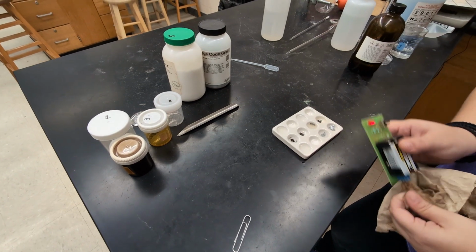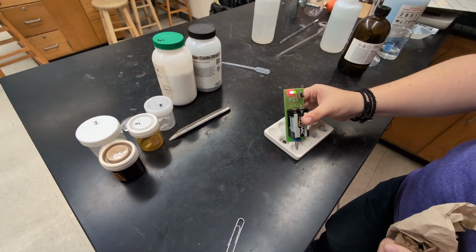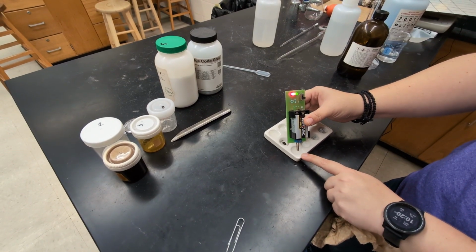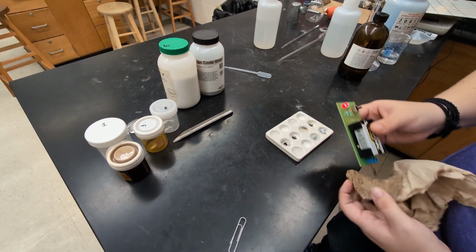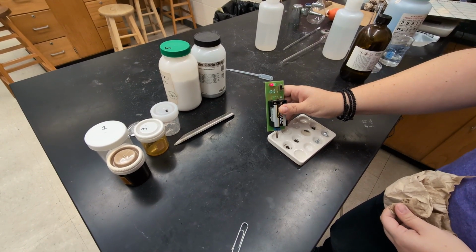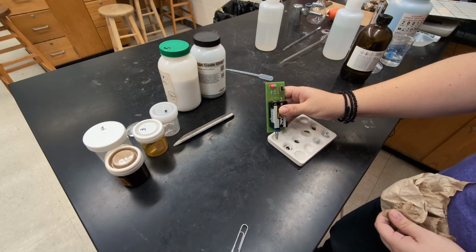But let's compare that to the last one here. Do you see the really strong light? So this one is definitely conducting to a high level. The first substance here might just be reacting to ions left over in the water from filtration.